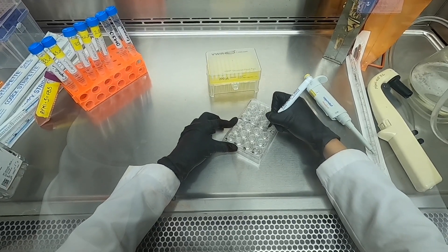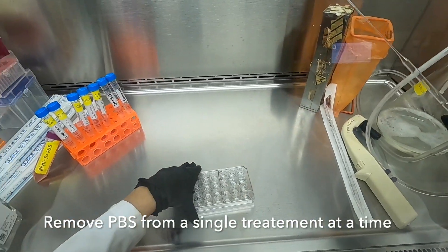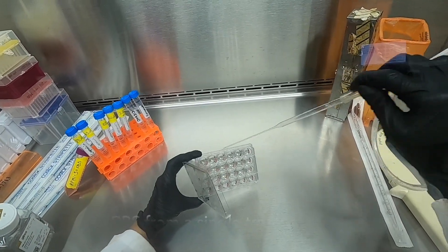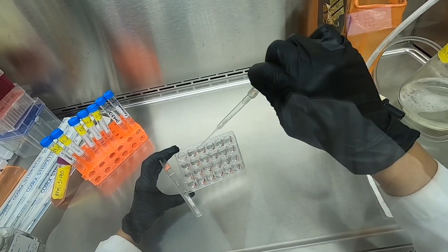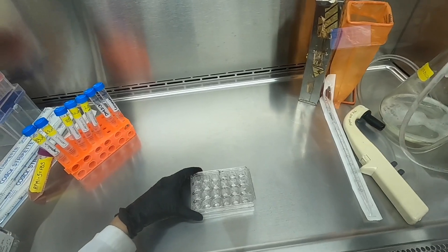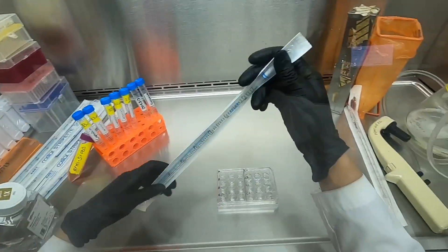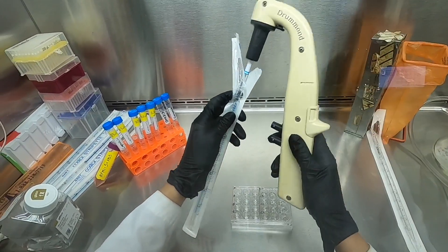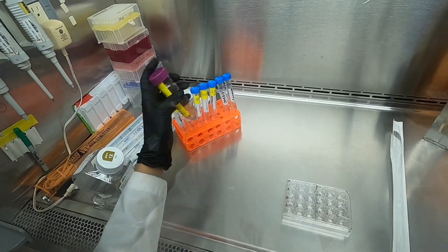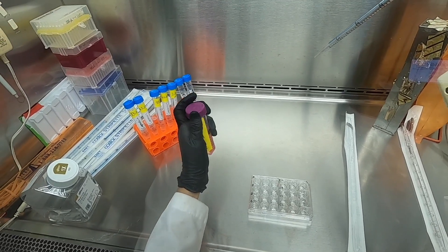Now that we have generated our wounds and our plate has been labeled with the correct concentrations, we will proceed to aspirate the PBS. This will remove any dead cells or any cells that were removed during the scratching process. We remove the PBS from only one set of cells at a time to allow us to replace each treatment individually and prevent the cells from drying.